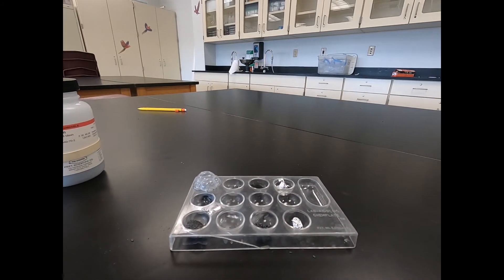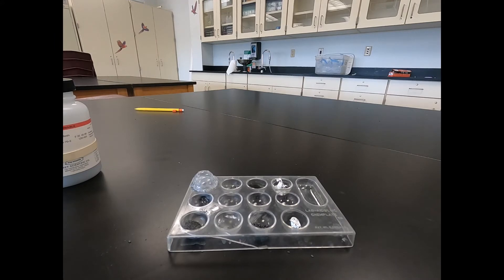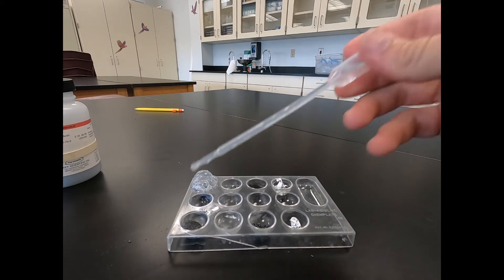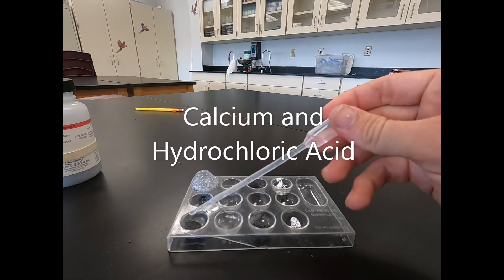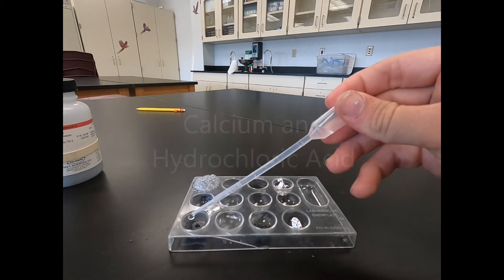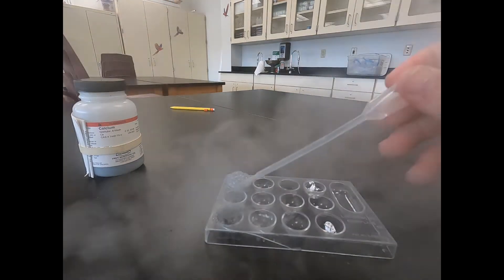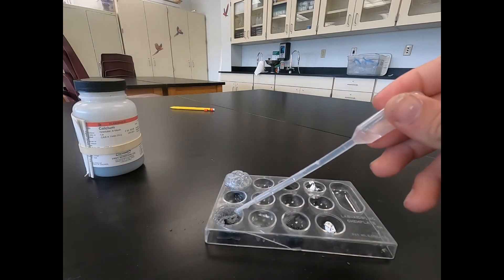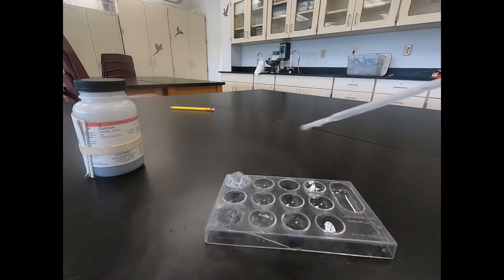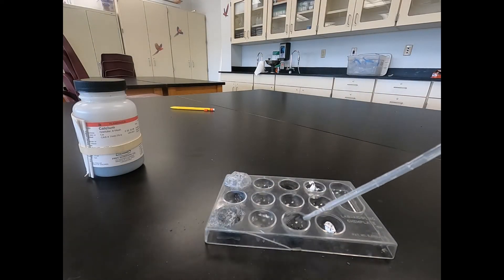Next we'll move on to hydrochloric acid — same process. We'll just take the hydrochloric acid; first we're going to do the calcium. Then we'll do our magnesium.